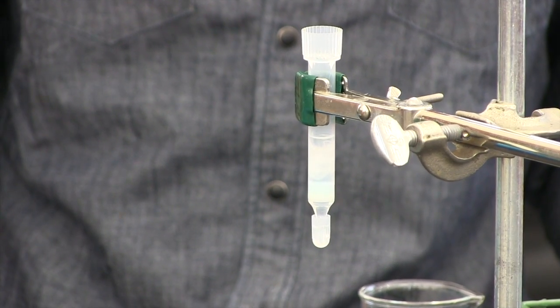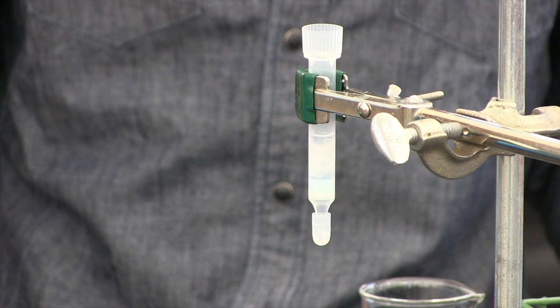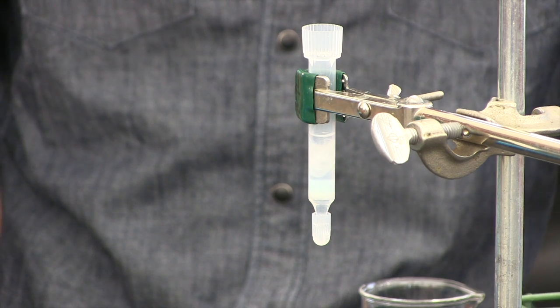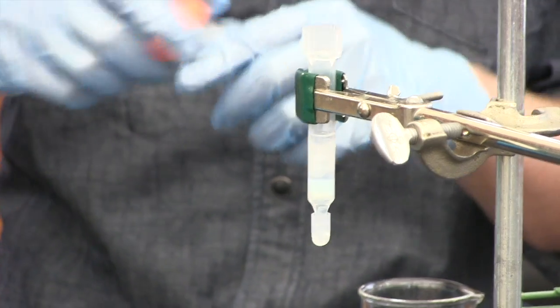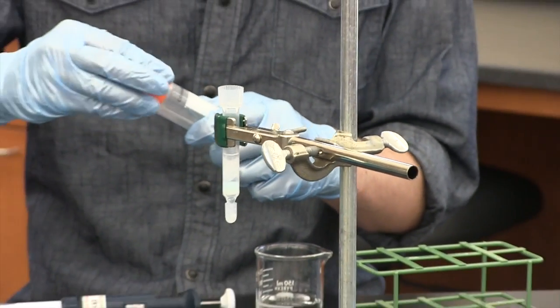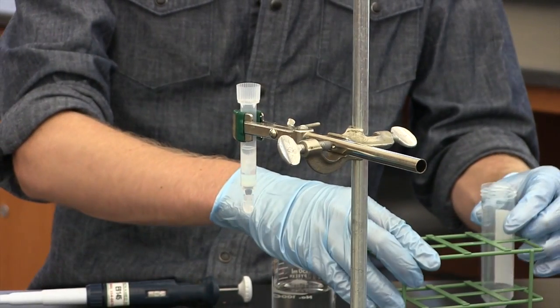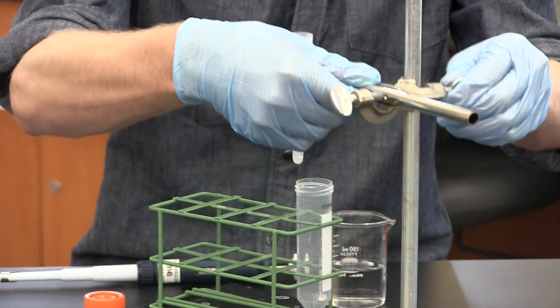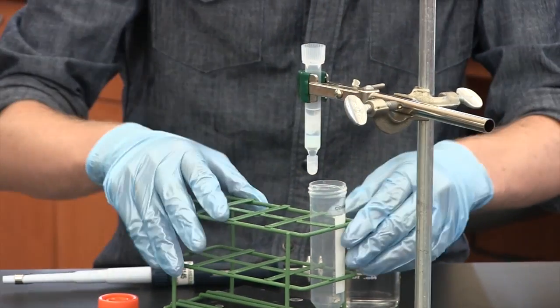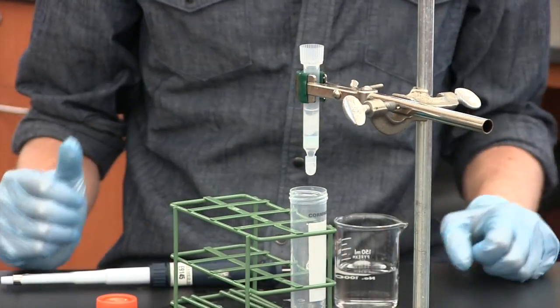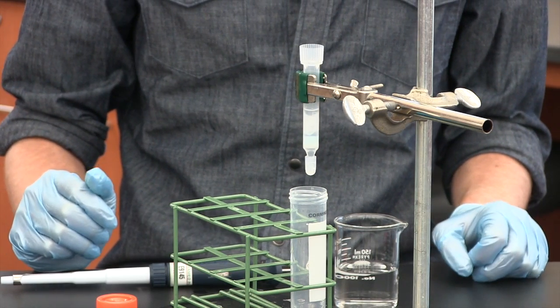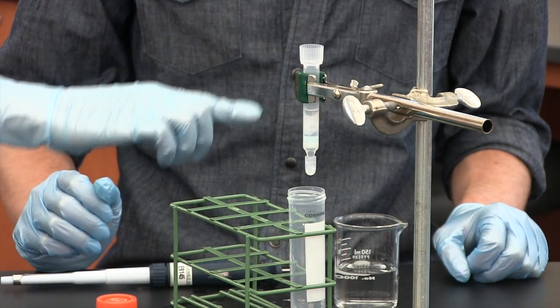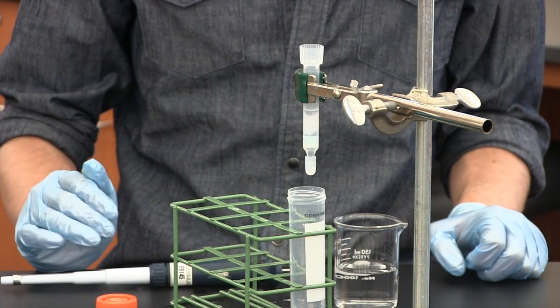Now our column is ready. Your next step would be to take the centrifuge cell lysate and run it over the column. As you do that, you want to collect the flow-through. You can take an empty, clean falcon tube and put it underneath your column. You might have to lift your column up a little. Just take the cap off and load as much volume as you can. You'll probably have to keep loading volume until you get it all run through. Cap it right before the liquid runs into the glass wool.